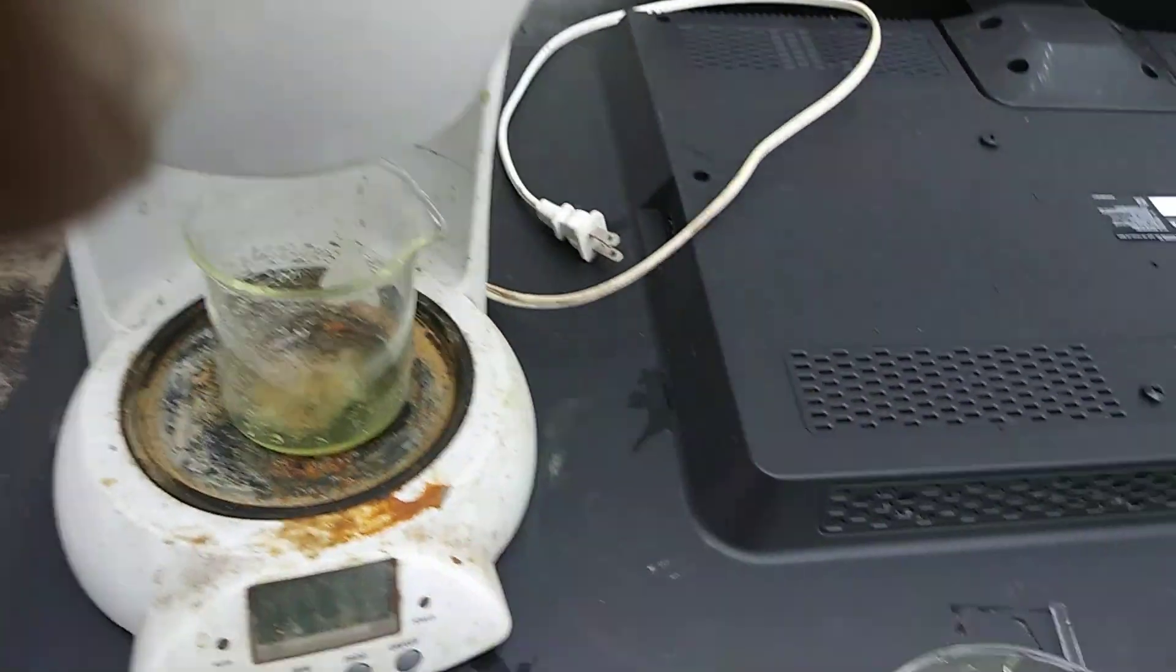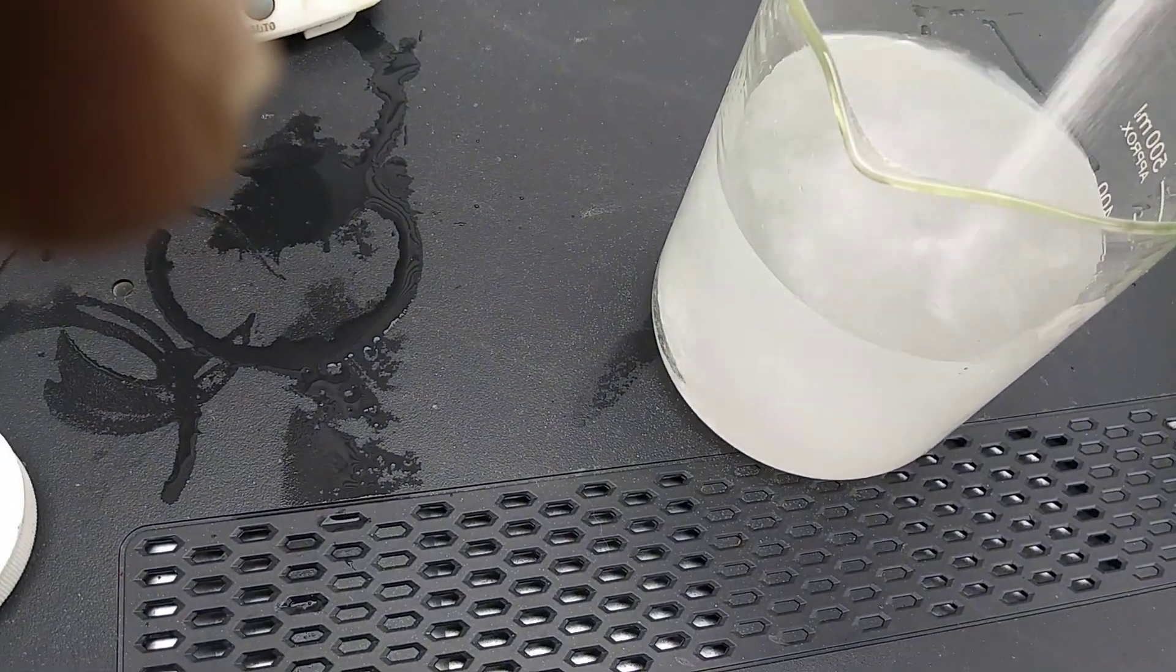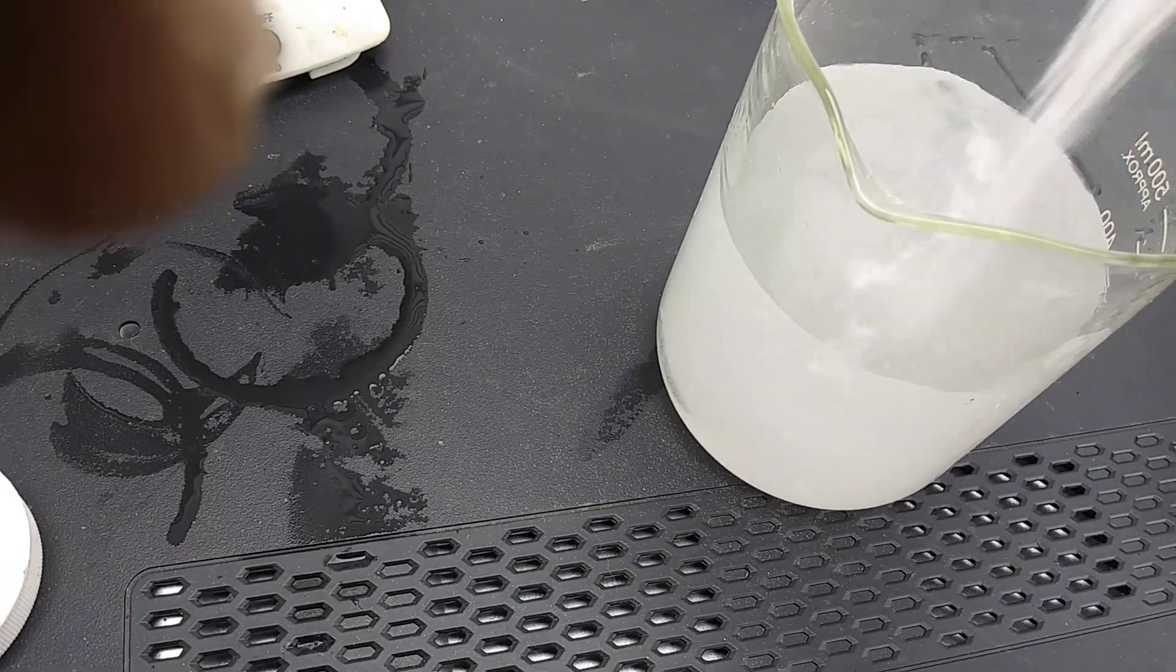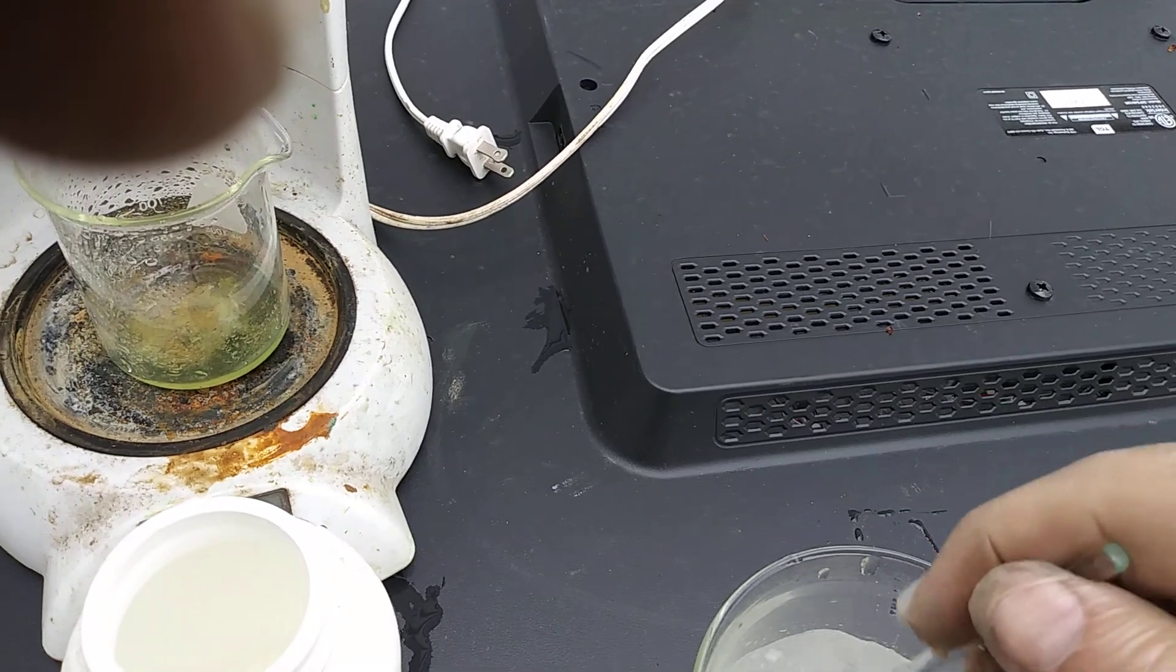Pounding in a glass beaker with a glass stir rod. Nothing can go wrong there, right? I'm gonna put a little bit more in there just for kicks and giggles.